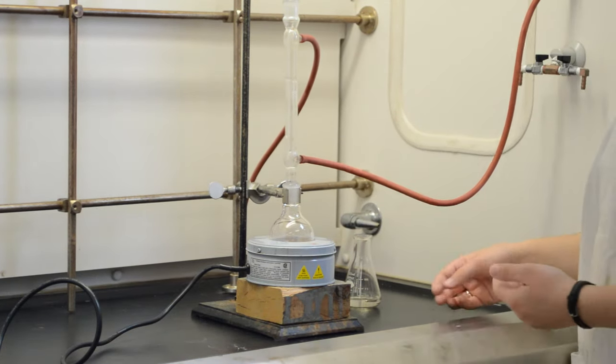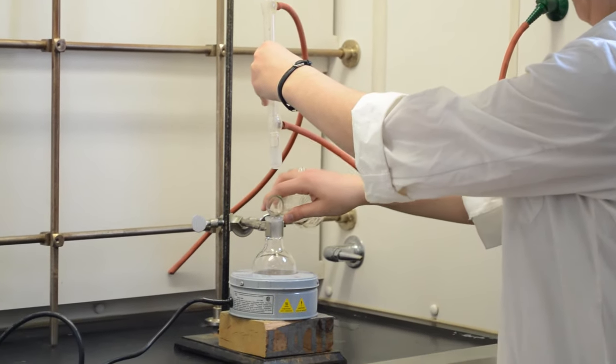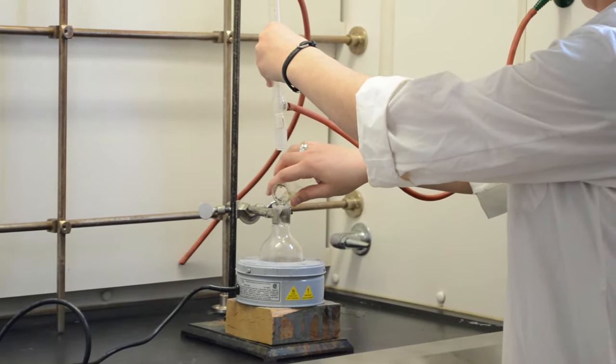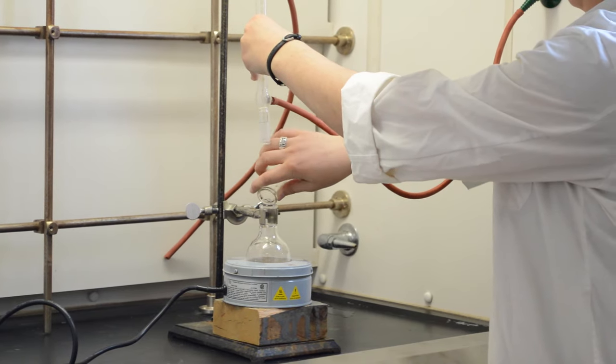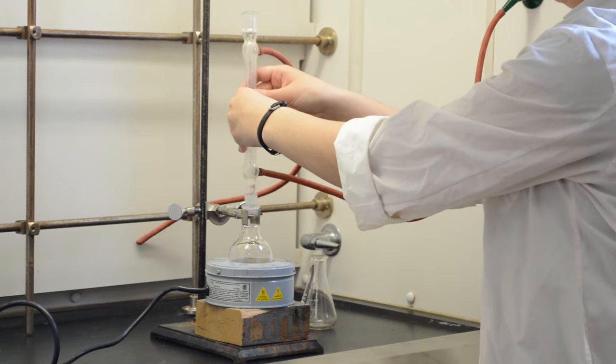It's useful to not clamp the condenser so that your solution can then be added very easily. Be sure to add a boiling chip to prevent bubbling over.